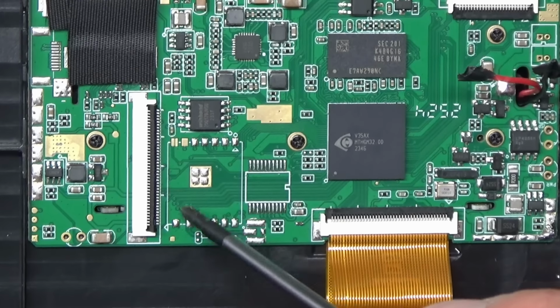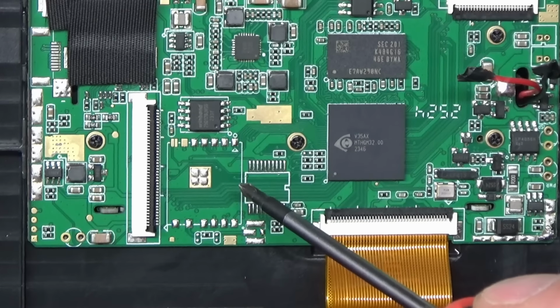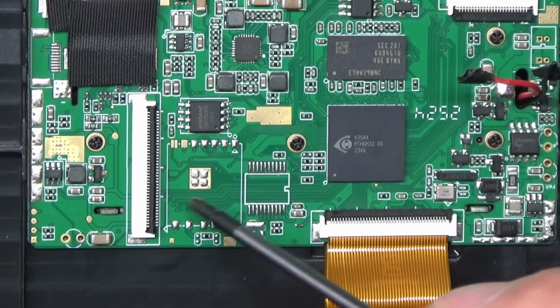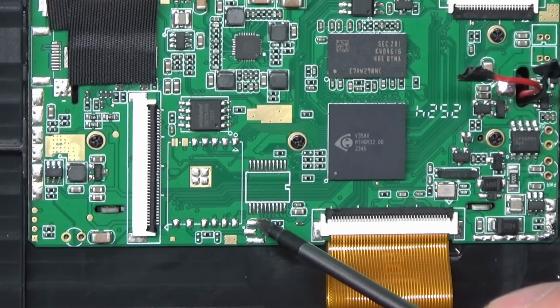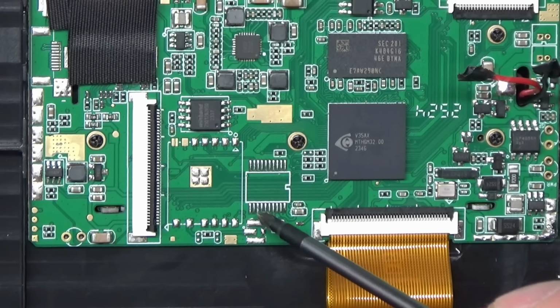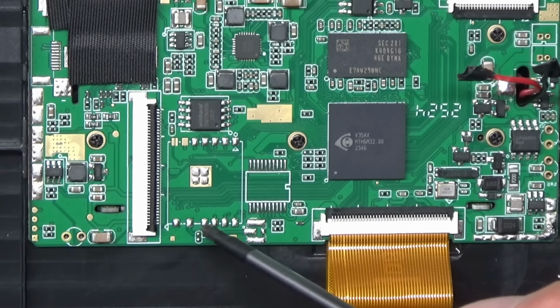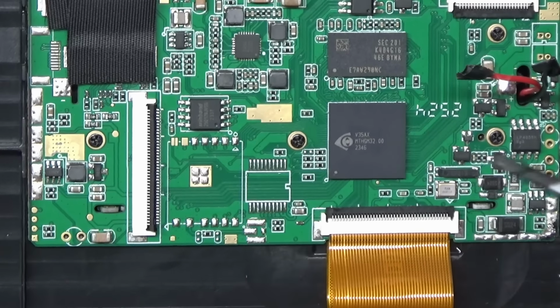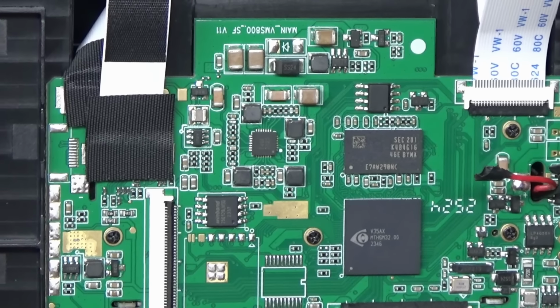I'm not sure what goes here, but it looks like possibly some option for, looks like a Wi-Fi module perhaps. Because that looks like it could be a connector for an antenna. And that looks the sort of footprint that I would expect for a Wi-Fi module. So that's what that might be for. There might be an option for Wi-Fi on this board.